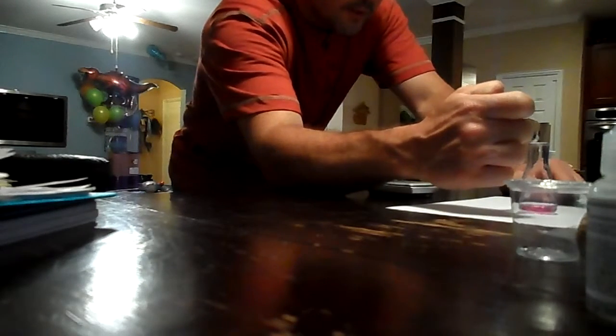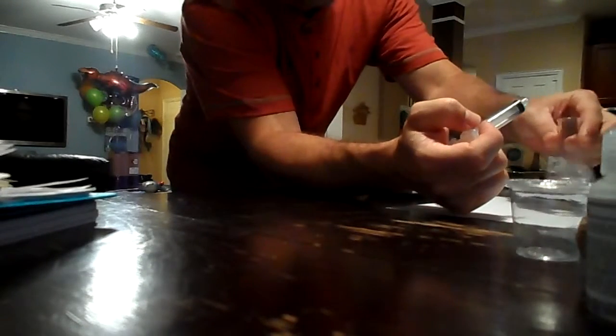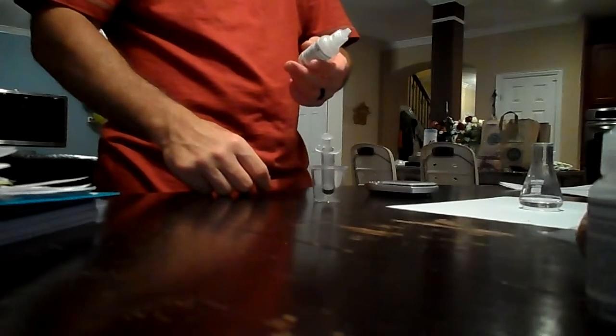Yeah, that's the whole 2.5. Okay, and then we measure it. I mean, we have to see what we have left in there. So, oh, we use all of it? No, I'm saying for the syringe, what it's asking is if we use the whole 10 milliliters. We only drew 2.5. Okay, got you. Because I think we're fixing to run out.